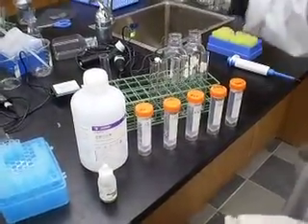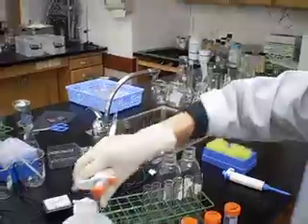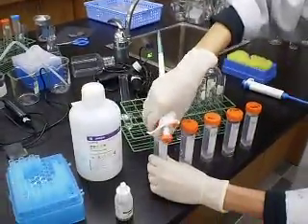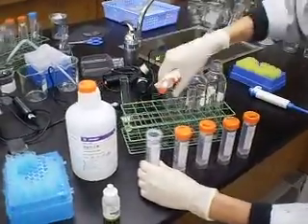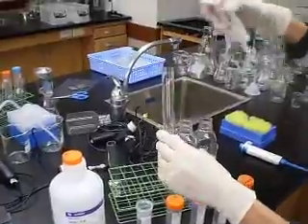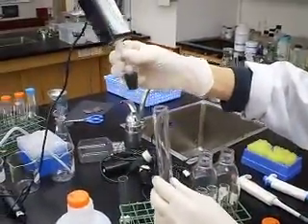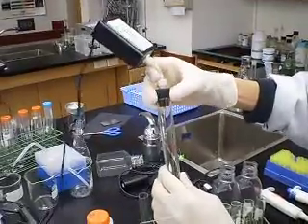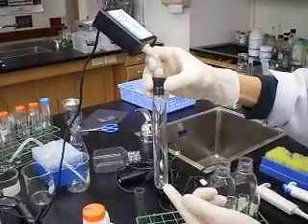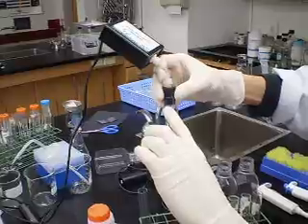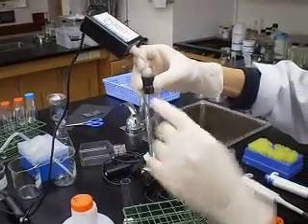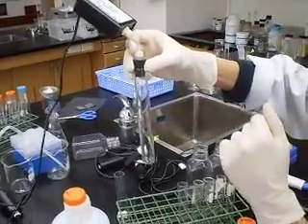For this part, I'm going to use a micropipette which is 1 mL micropipette. I'm going to take out 3% of hydrogen peroxide and put it inside this little test tube here. And this little test tube here fits into the gas pressure sensor. Put it in, make sure it's completely airtight. When oxygen gas is produced, pressure will build up. There will be a pressure change over time. That will be the rate of reaction.